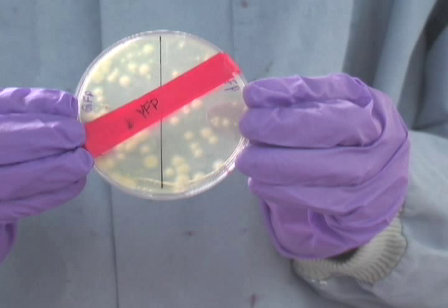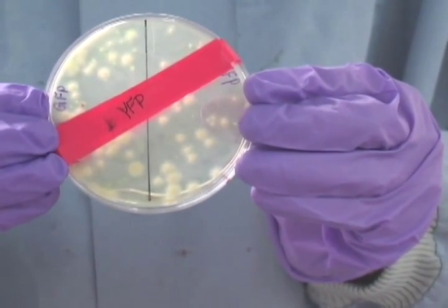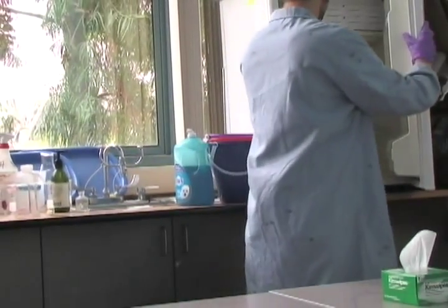Put your initials or group number on the plates. After that, place your plate in a 37°C bacterial incubation oven overnight to incubate.